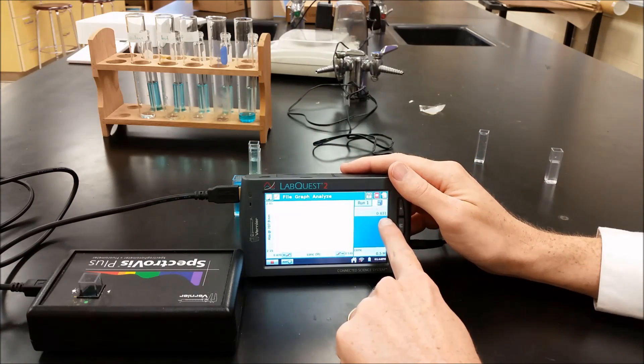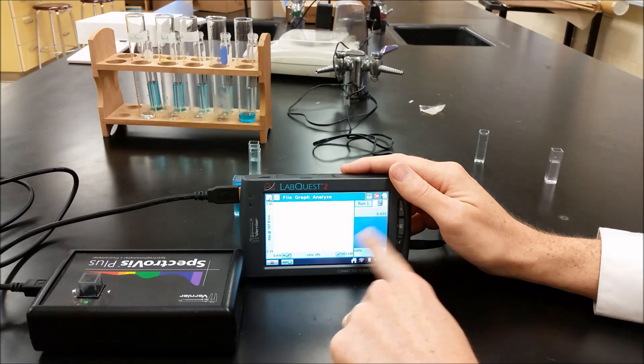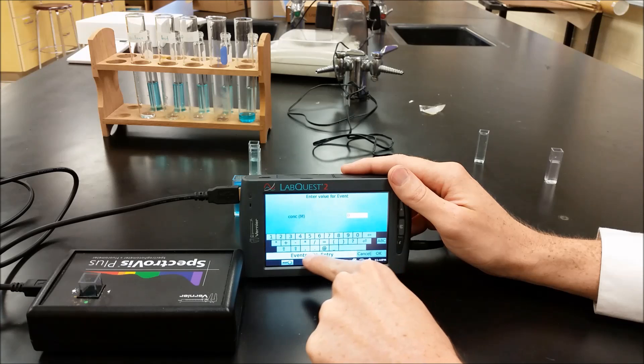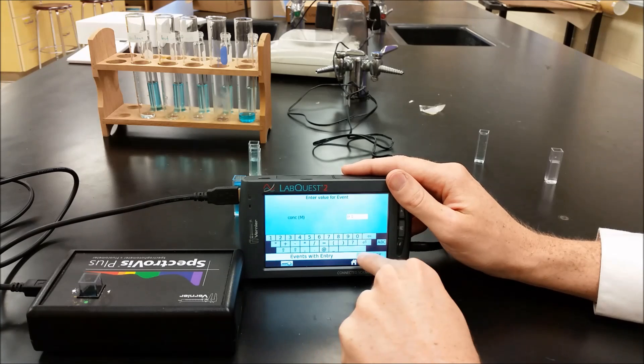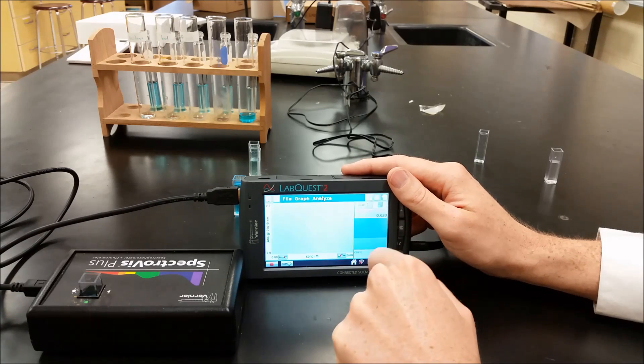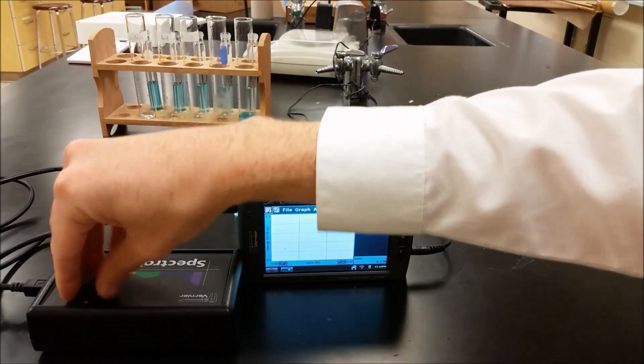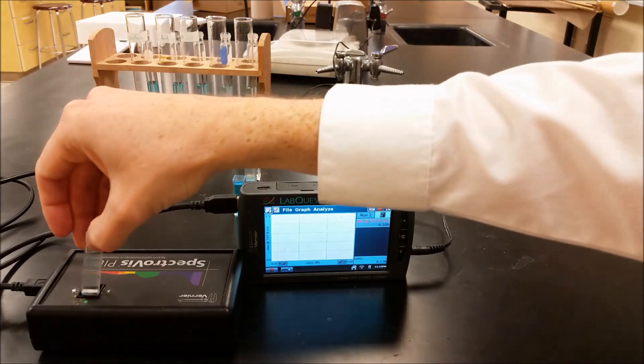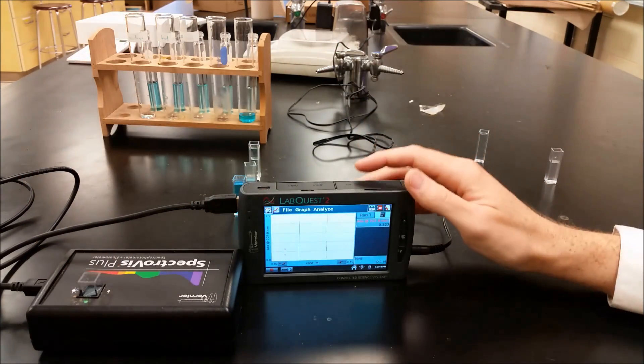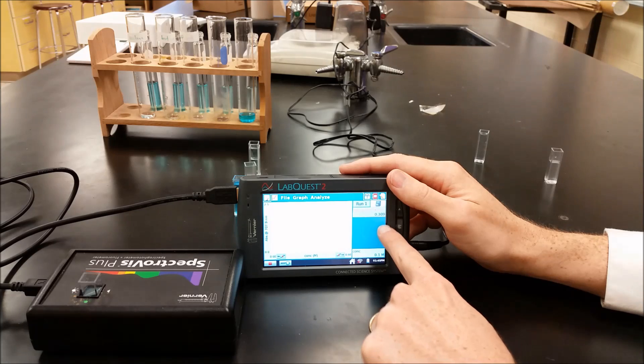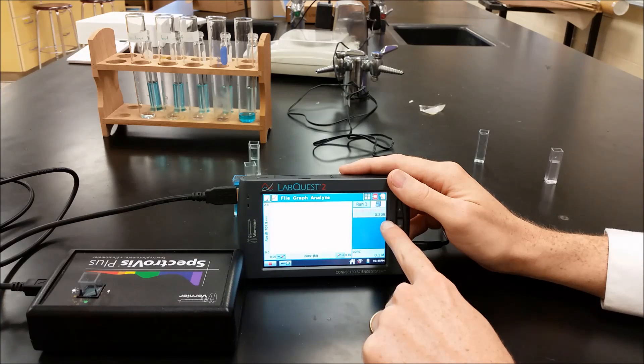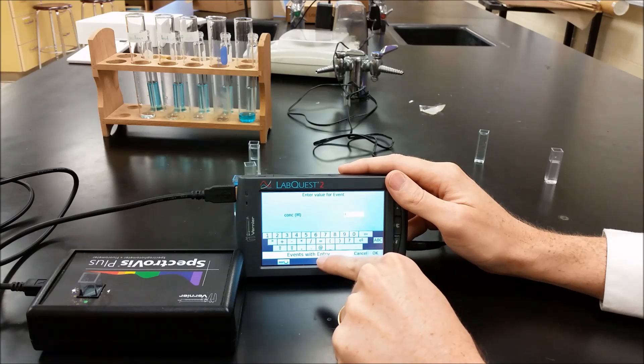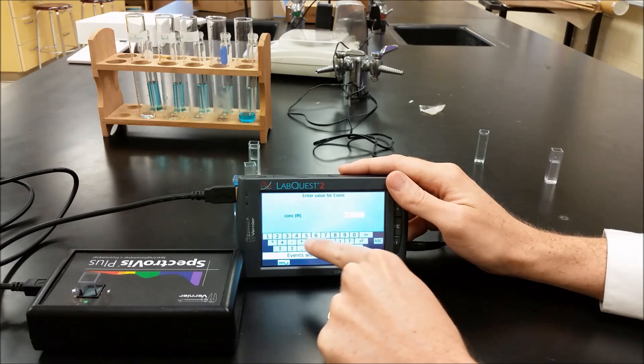So again, here we see our absorbance. And it's steady. We're going to keep that. And that is 0.1 molar. And we can see that line forming. So we'll continue on. And we'll keep that. And that was 0.05.